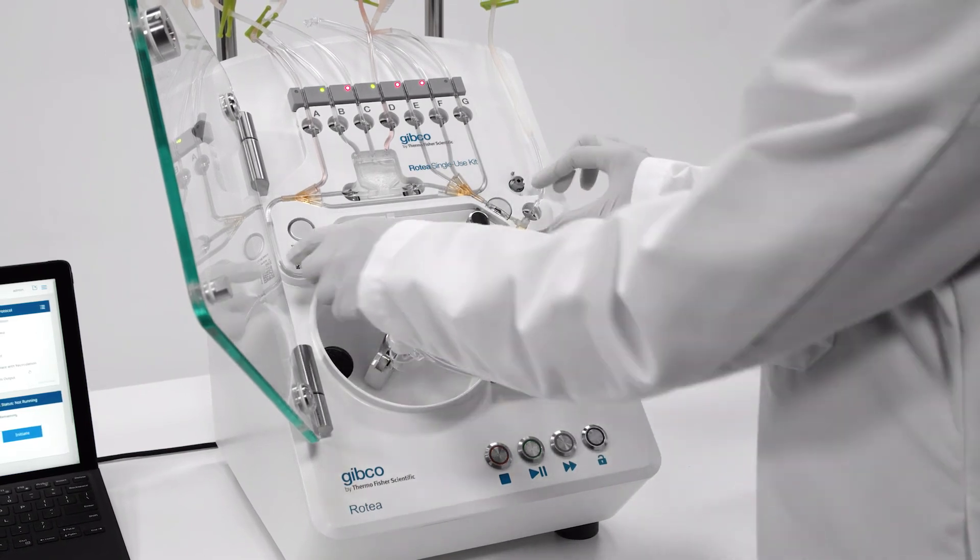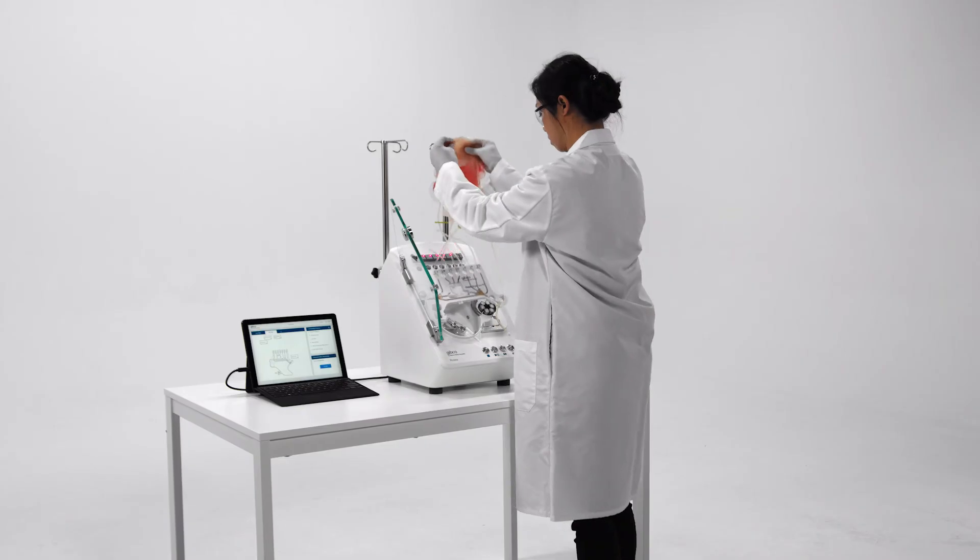Pull the bulb connector out of its fitting and lift the kit away. Finally, dispose of the kit and unwanted bags in biohazard waste.